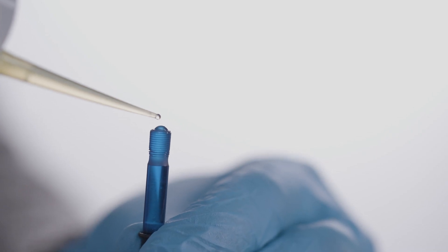Check the meniscus on the shaft end. If needed, use the syringe filled with distilled and degassed water to build up a meniscus.